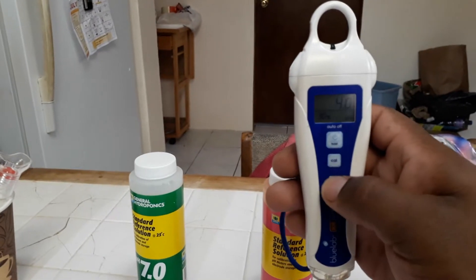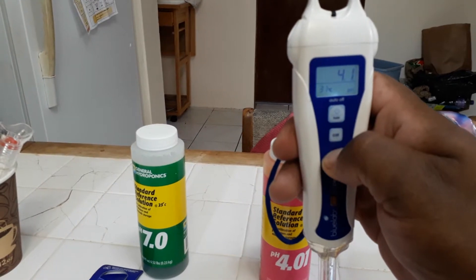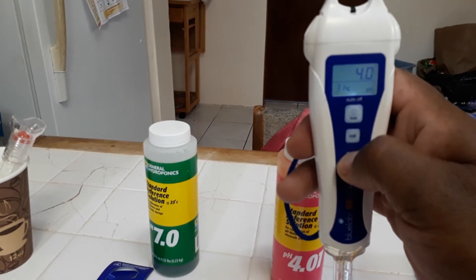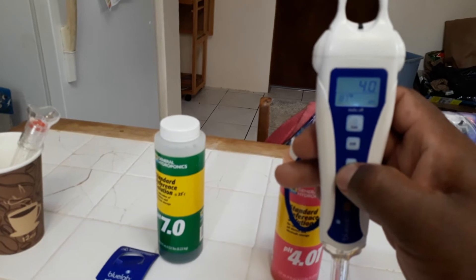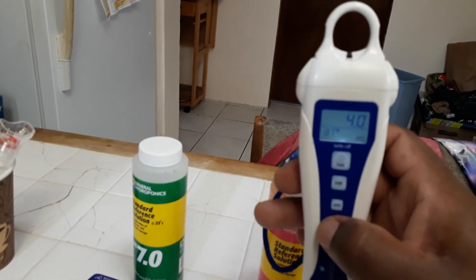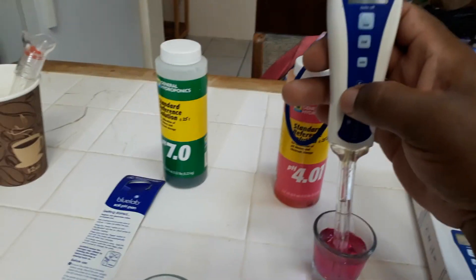Now I'm going to change my temperature units. You hold the units button down until it flashes, then push the button once or twice to toggle between Celsius and Fahrenheit. I've put mine on Fahrenheit. After that, before calibrating the probe again, it's already picked up 4.0 — so this is really good, I like this meter.